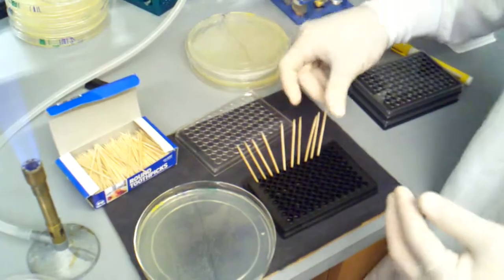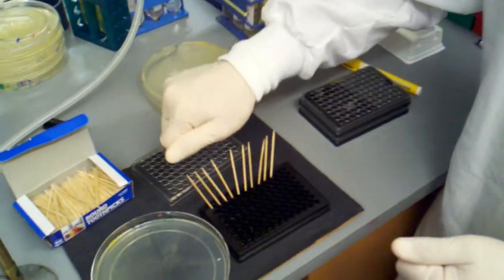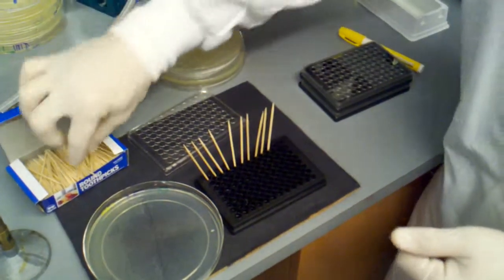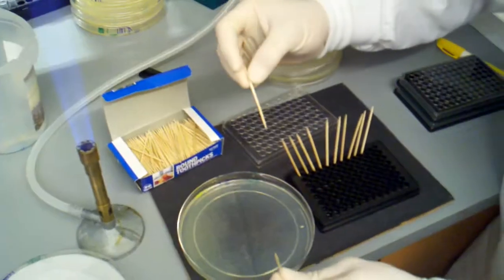So then we would just do this for 96 of the wells. And then at the end we'd slowly want to take out these toothpicks. We'll just do this for the last two, just to show you how to take these toothpicks out.